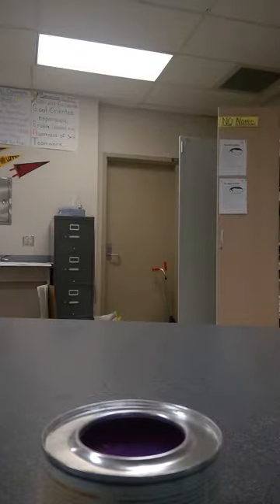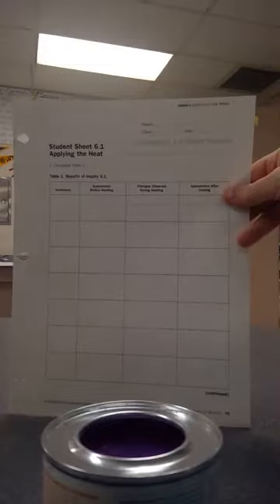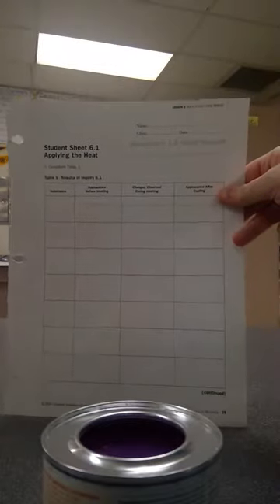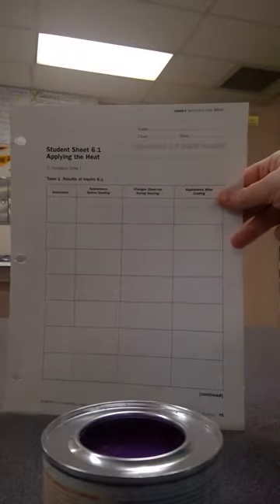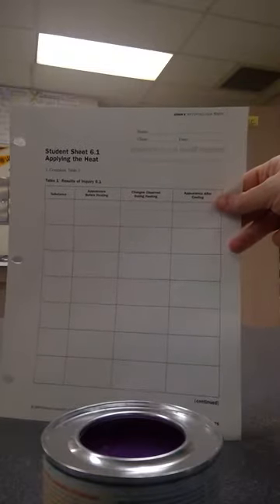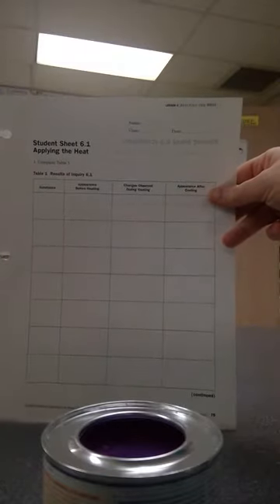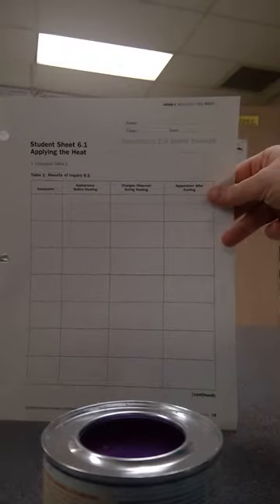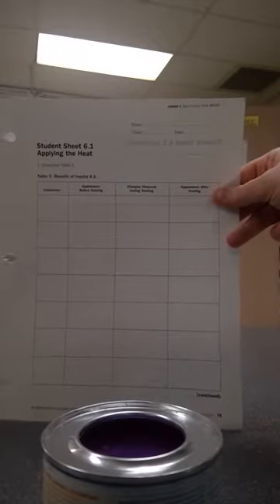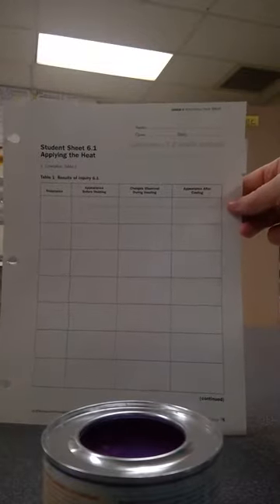Today we're going to be working on lab 6. You should have a digital version of this worksheet. We'll be identifying the substances, examining them, and writing down all of our observations for each of the substances prior to heating. We'll be discussing the changes that occur while heating, then let them cool down and observe the appearance after cooling.